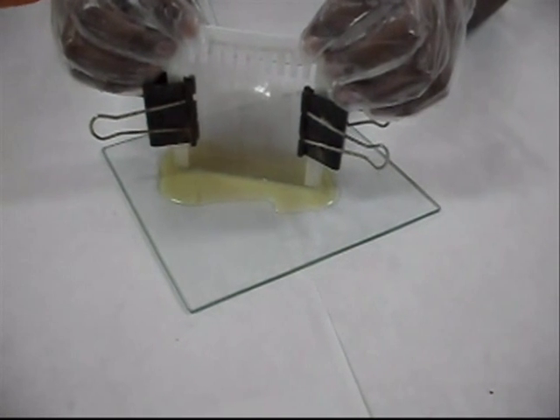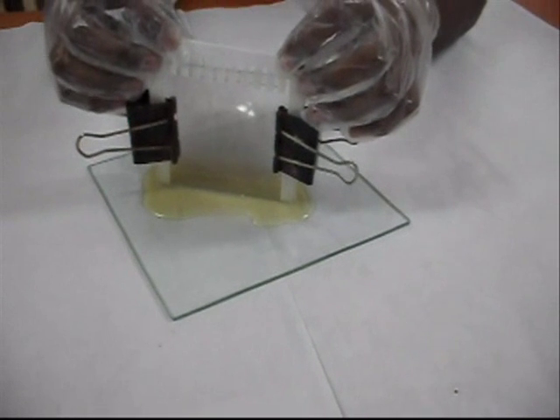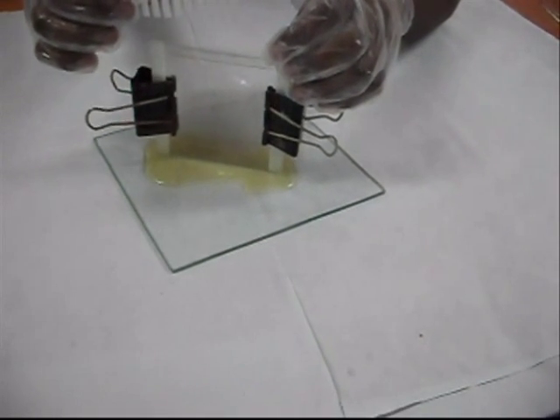The comb piece is pulled out from the gel after proper solidification, carefully avoiding any damage to the gel.